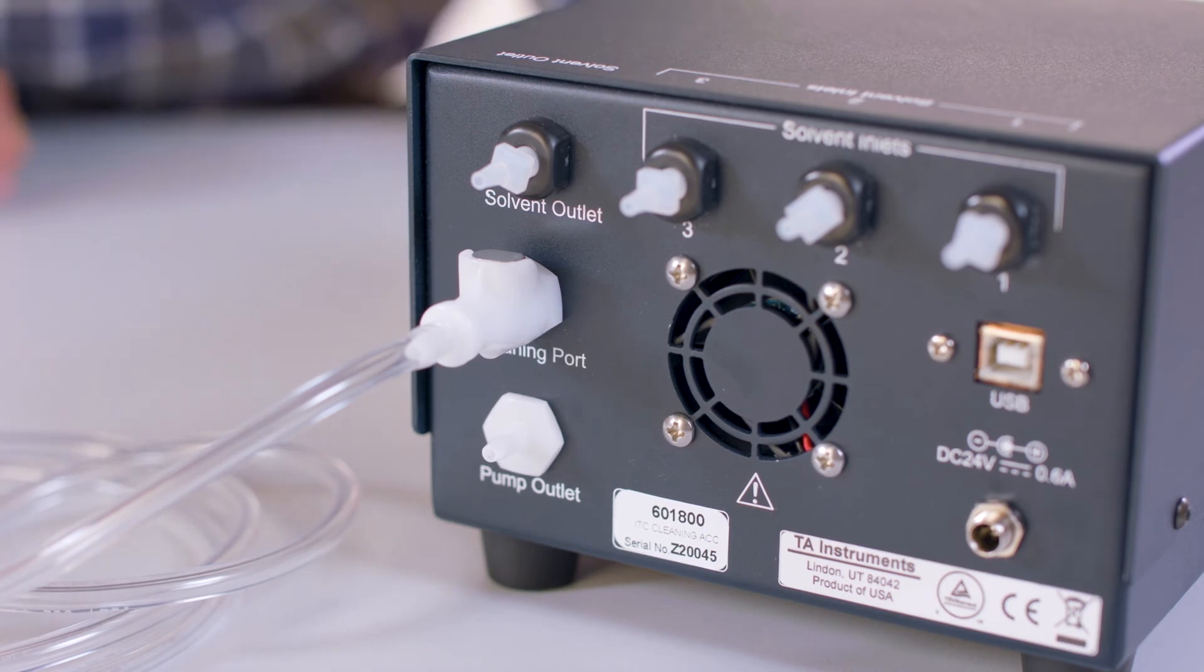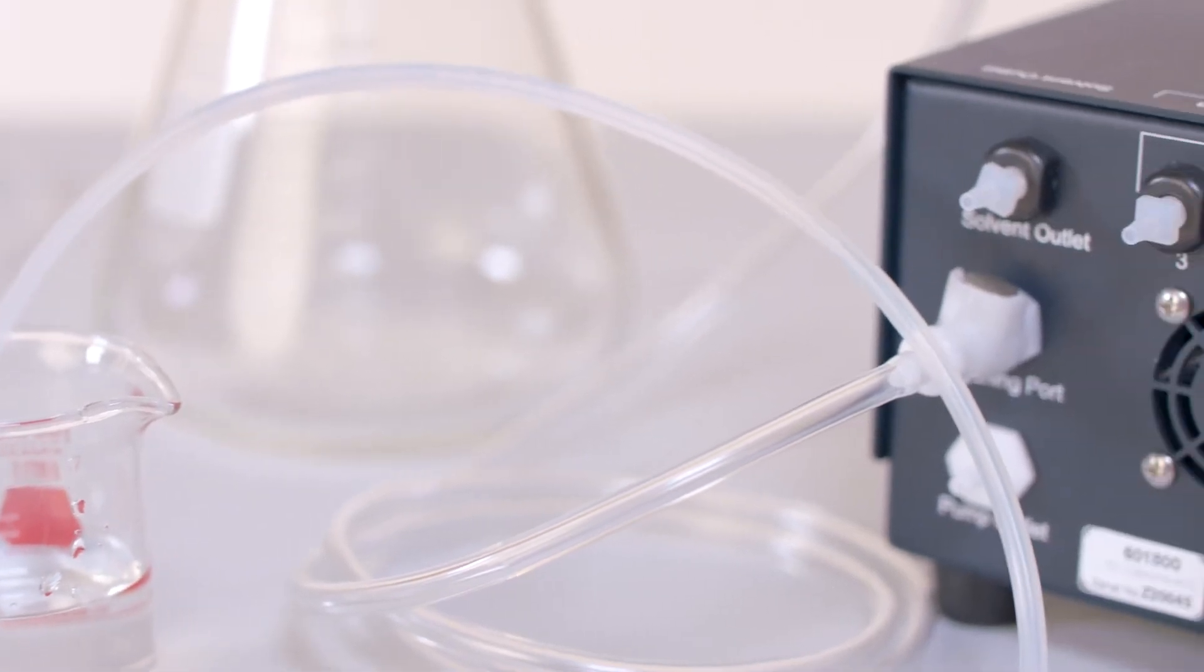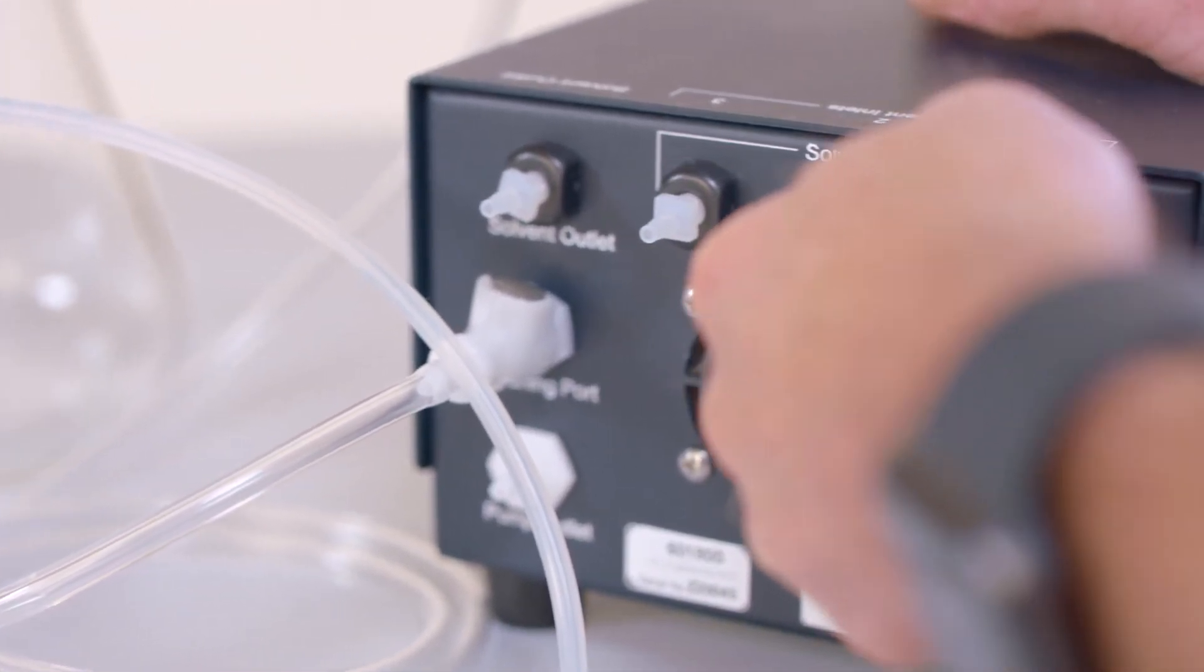Now we can set up the rest of the tubing. The cleaning station can be paired with up to three cleaning reagents, but for demonstration purposes, I will pair with water and solvent inlet one.